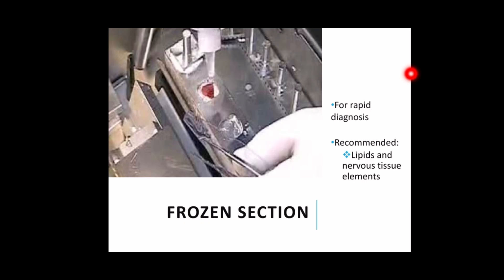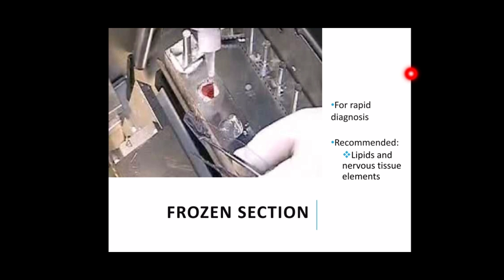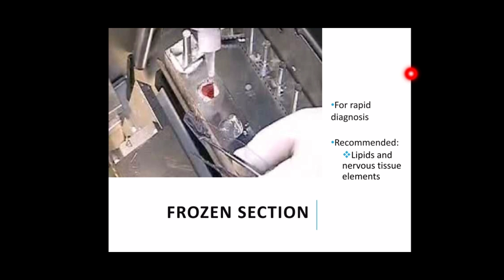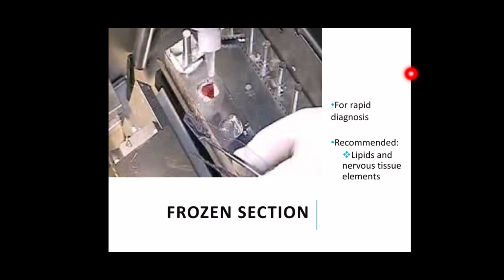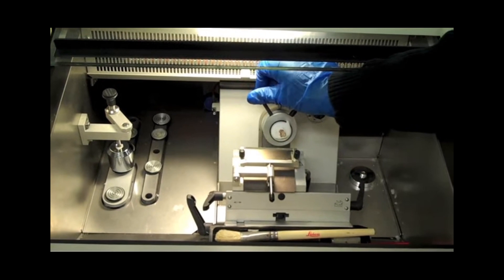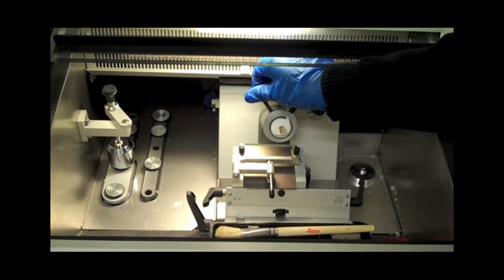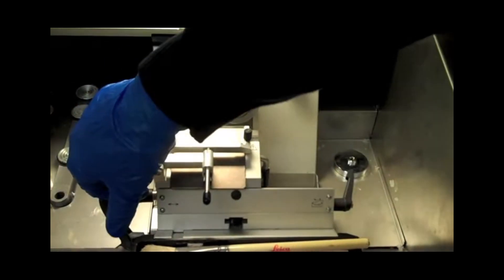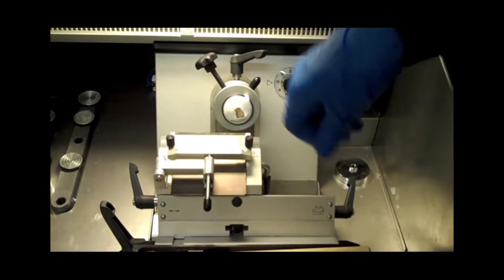Another technique is through frozen section. This method is normally utilized when a rapid diagnosis of the tissue in question is required. Usually you can get the results within 5 to 15 minutes from the surgery, from the patient's body going to the laboratory, processed, and results returned. This is also especially recommended when lipids and nervous tissue elements are to be demonstrated.